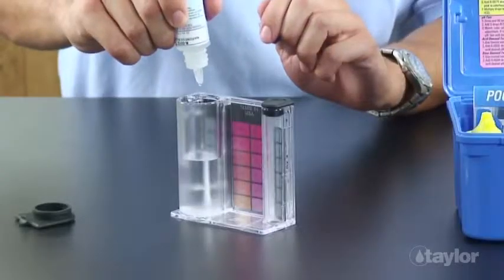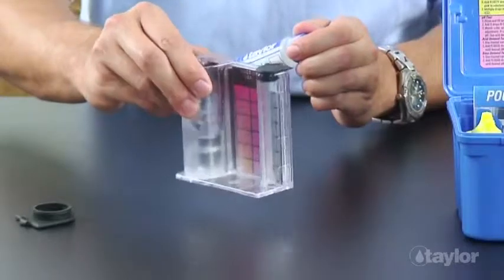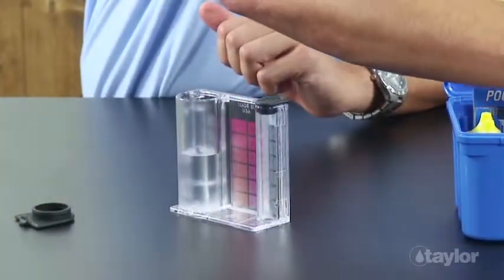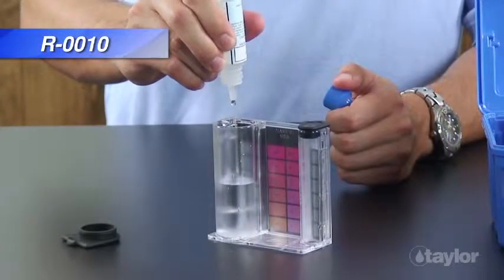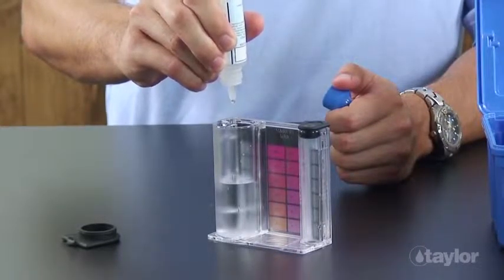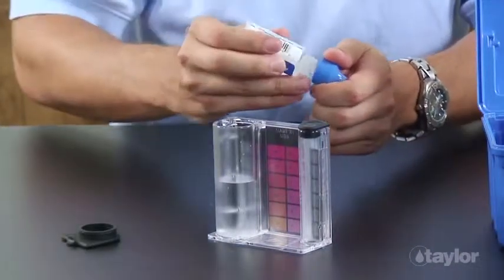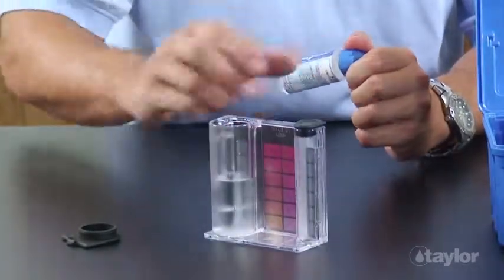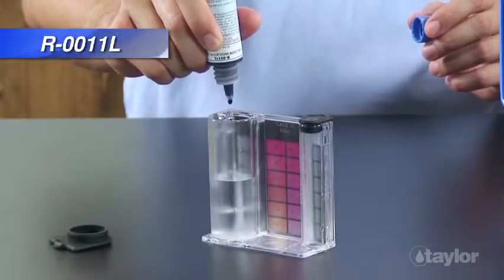Record the number of drops used. Swirl to mix. Add 20 drops of reagent 10. Swirl to mix. Add 5 drops of reagent 11L.